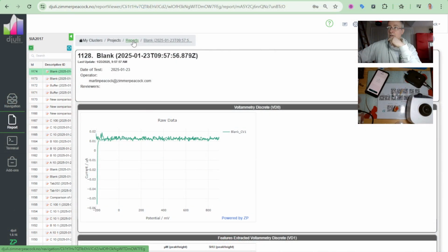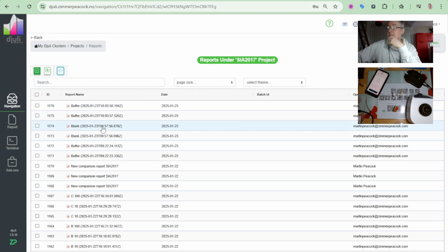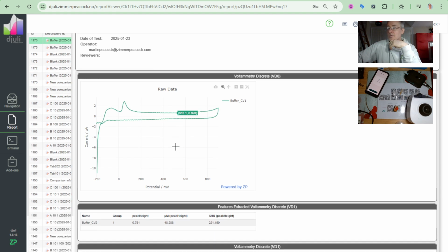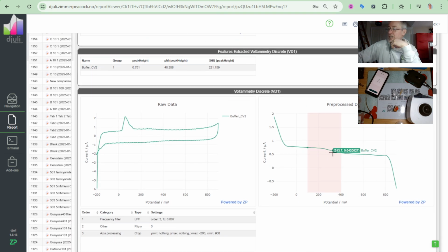Let's just go up there and have a quick look at that. And I'll just do a quick refresh here. So I can see my data here, buffer. And I can see a very uneventful trace. Where's my peak 1, my peak 2, and my peak 3 for capsaicin? Where is it? Well, it's not there because I put on a buffer. And you can sanity check yourself. You can just look there and say, there's a moment where you are involved with checking the quality of your own work, because I can see there's nothing there. I've got to troubleshoot this.